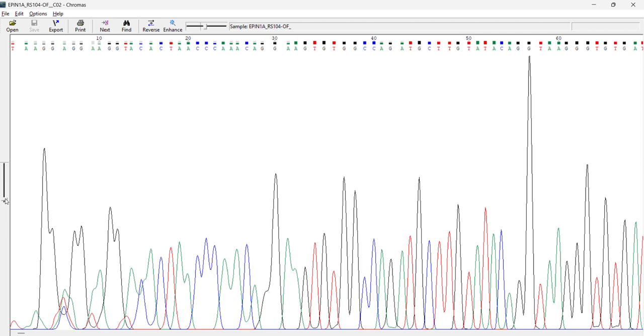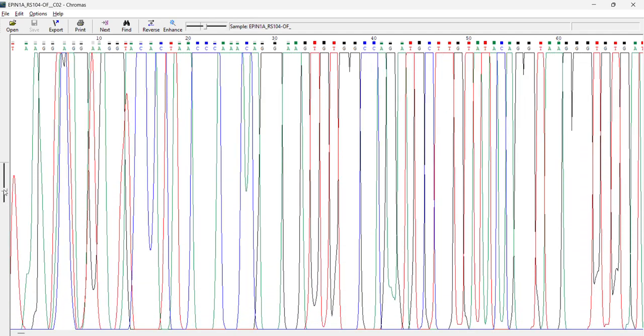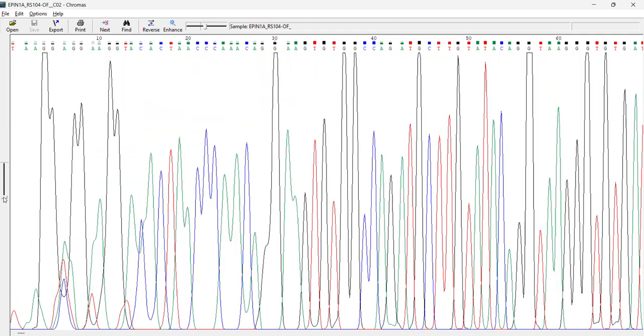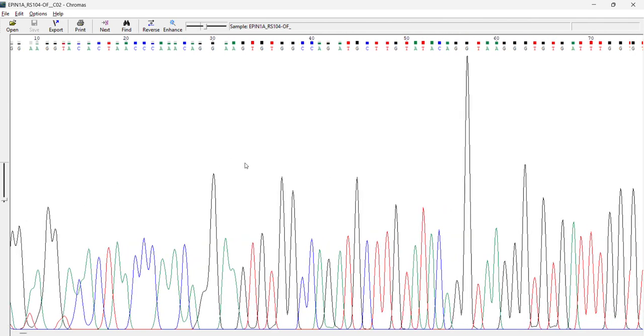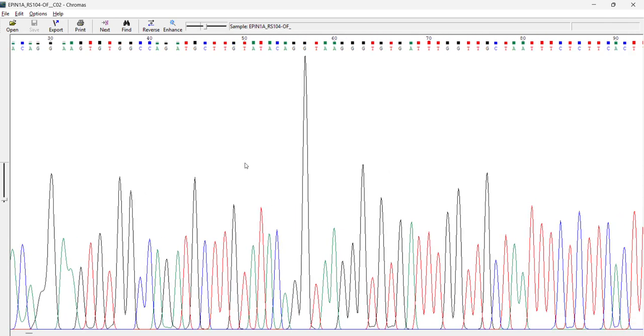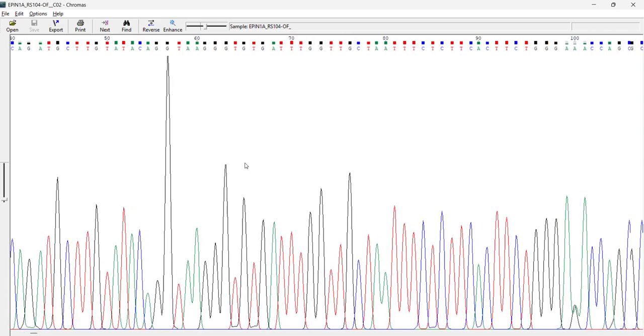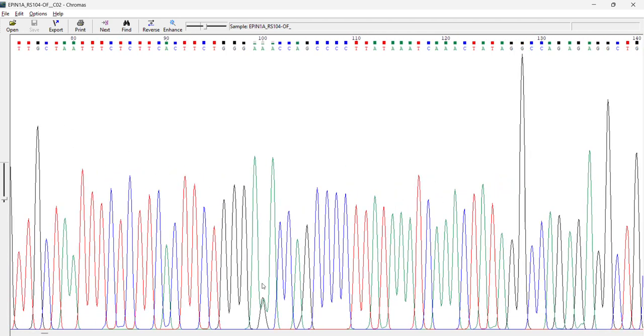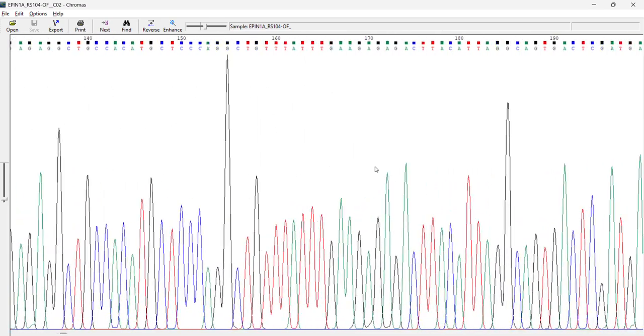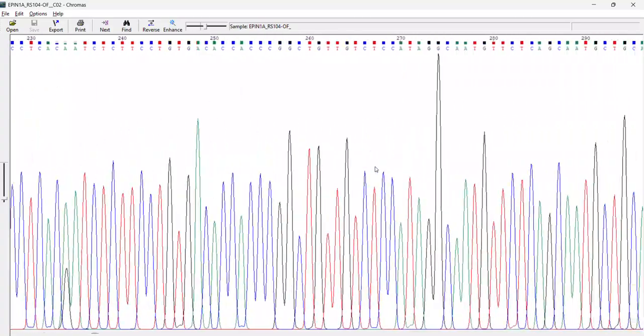And that's all. So we have this zooming bar here. If I use it, it becomes something like this, right? And to move it left and right, I will use my keypad. So this way I can move it. As you can see, it is a very nice and clear chromatogram with very little noise. Somewhere you can see one peak over the other. This area is generally denoted as a heterozygous condition, right? Same way, if you move till the end, it's quite big.